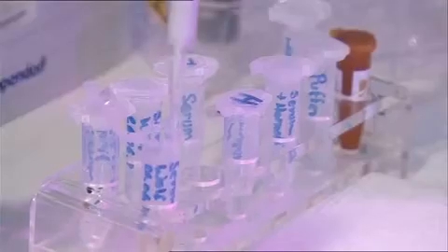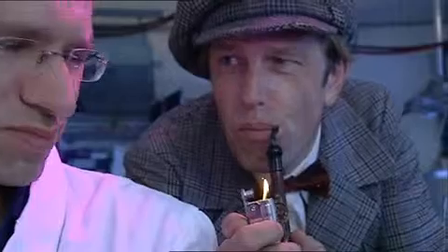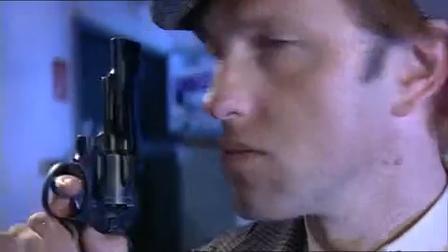After suitable preparation of the blood, the almost clear blood serum is being pipetted onto a protein chip. This requires lots of light. Laser light. Inside this mass spectrometer, the blood gets shot at to uncover the hidden information.